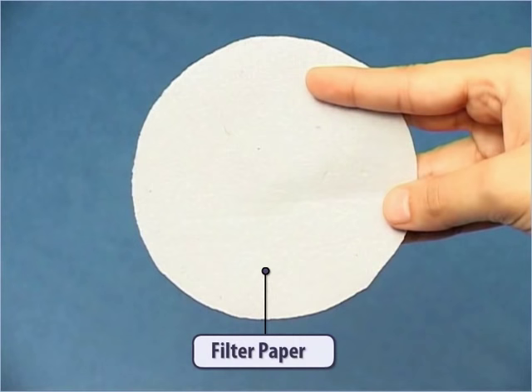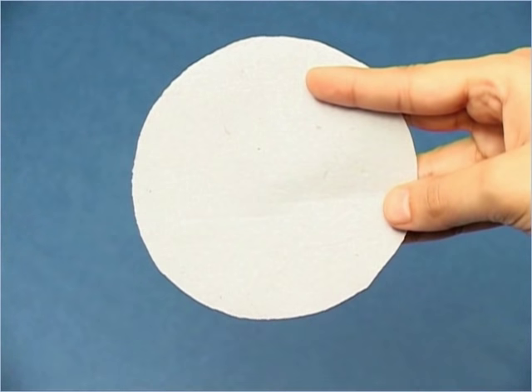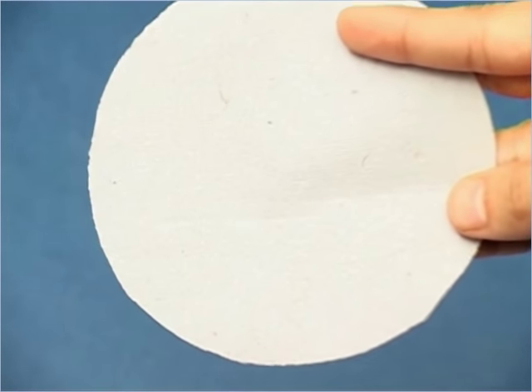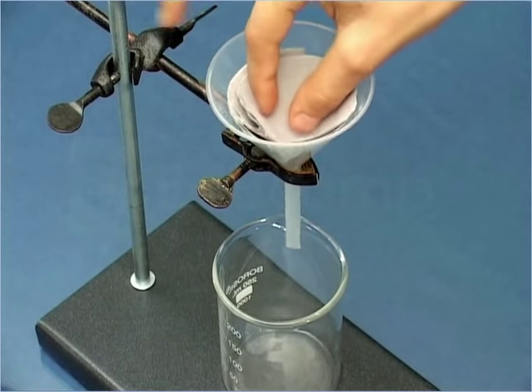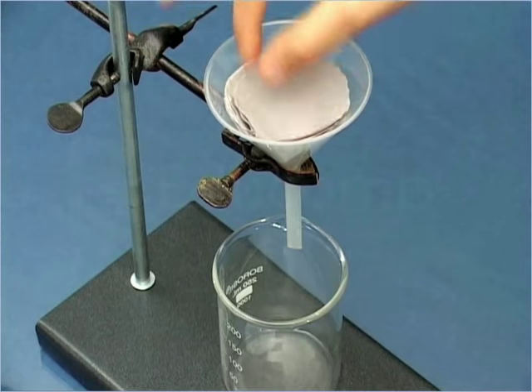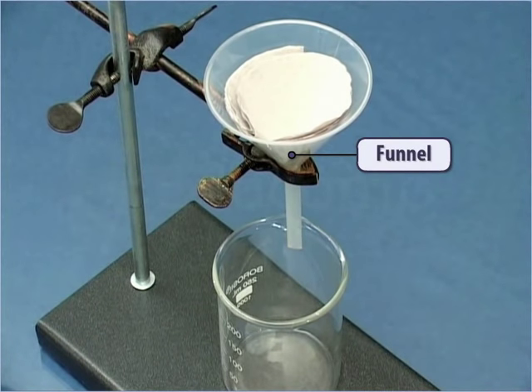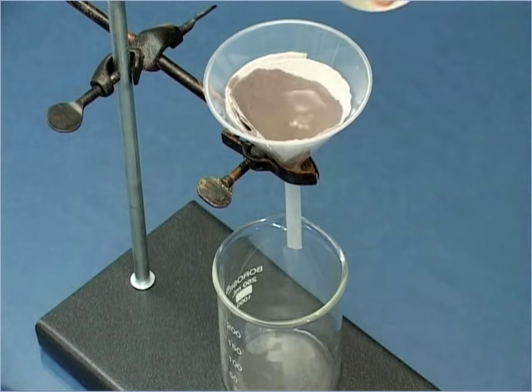A filter paper can separate the fine particles of mud from the water. A filter paper has smaller pores than cloth and hence can be used for this purpose. Place the filter paper in the funnel and pour the water obtained after filtration with the cloth.